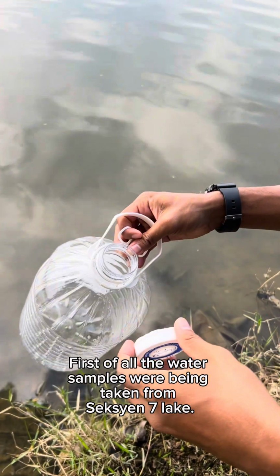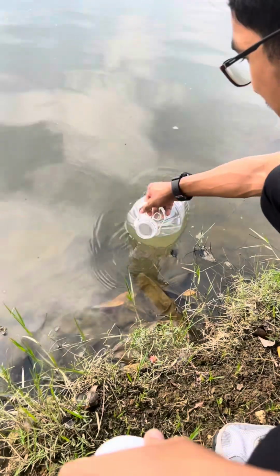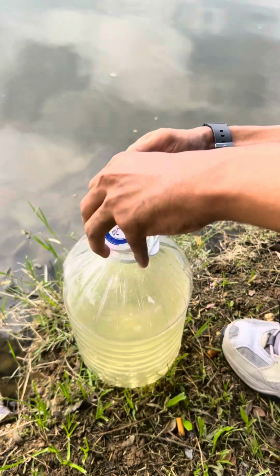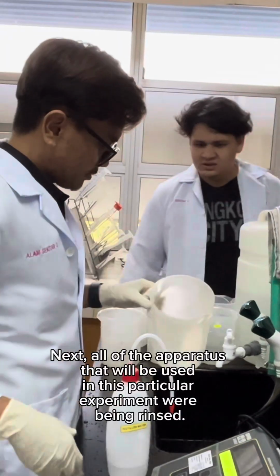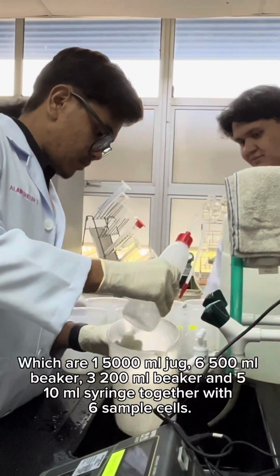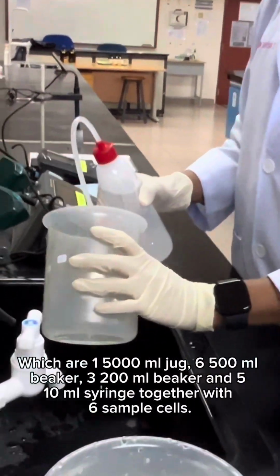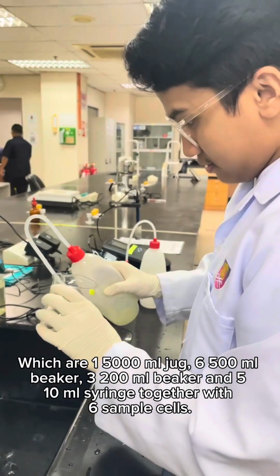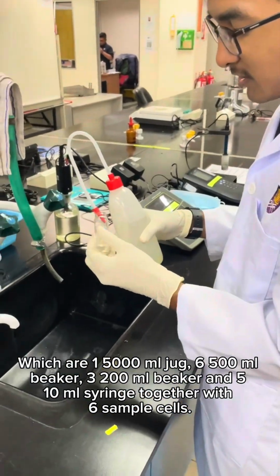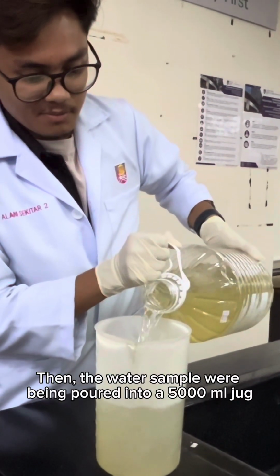First of all, the water sample was taken from Section 7 Lake. Next, all of the apparatus that will be used in this particular experiment were rinsed, which are one 5000 ml jug, six 500 ml beakers, three 200 ml beakers, and five 10 ml syringes, together with six sample cells. Then, the water sample was poured into a 5000 ml jug.